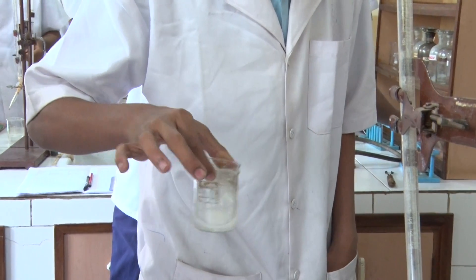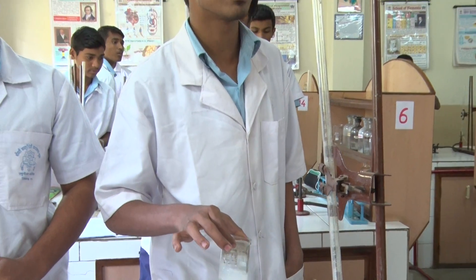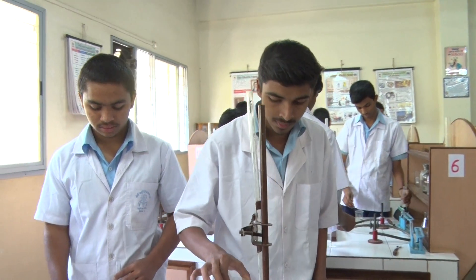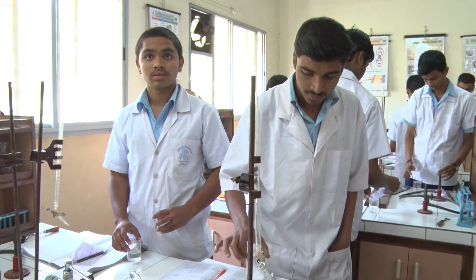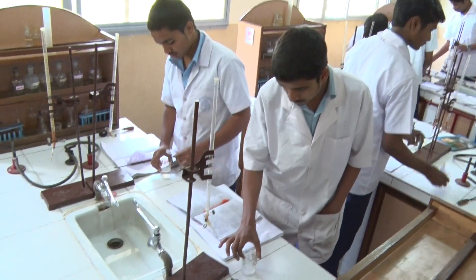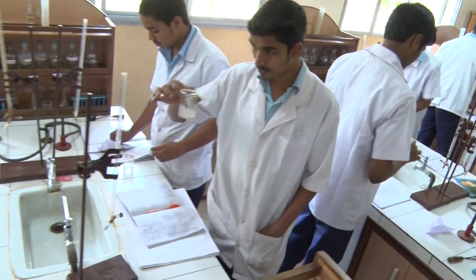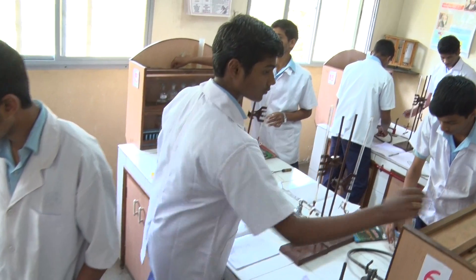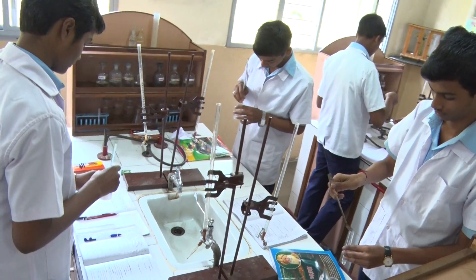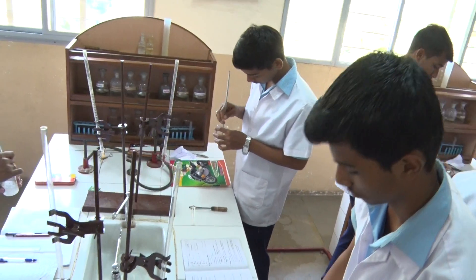Now we are going to prepare the original solution. This salt is soluble in water. Take a beaker and dissolve this salt into the water, then stir it properly.